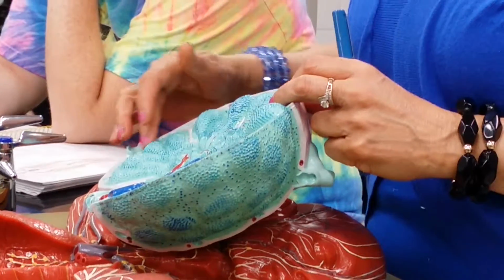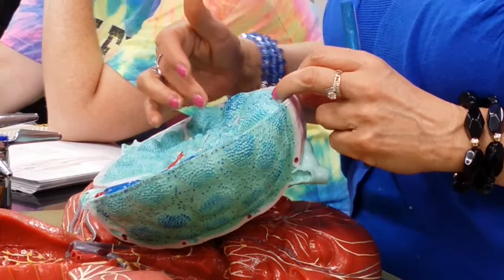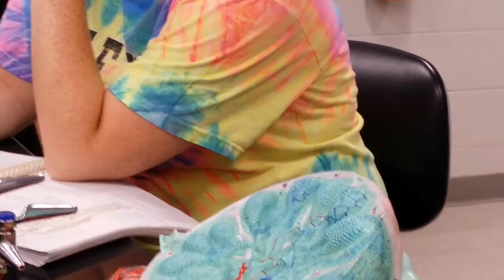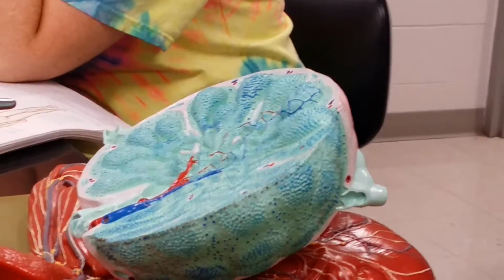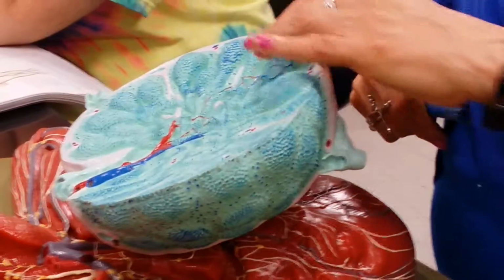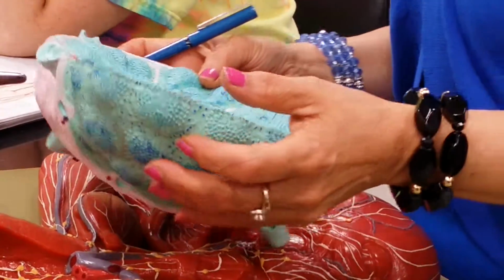This would be subcapsular sinus, this would be cortical sinus here, these would be medullary sinuses, but they're all lymphatic sinuses. If you ask that though, the sticker's not going to be on a borderline. It'll be way in the middle where we'll know for sure. So 3 types of lymphatic sinuses are there for you to identify.